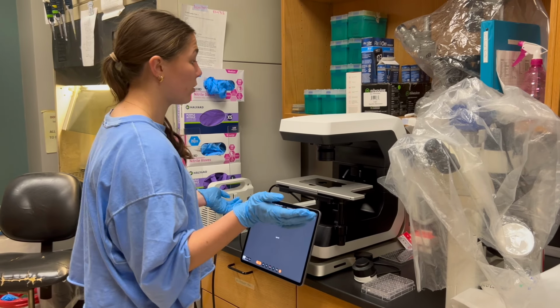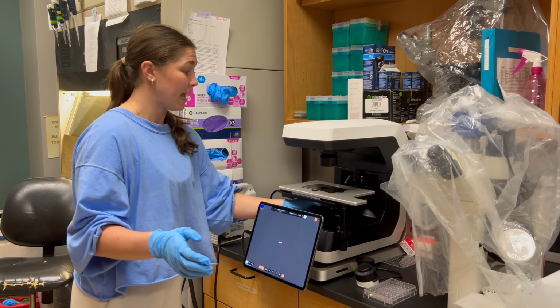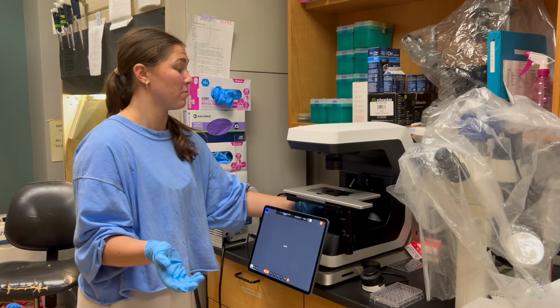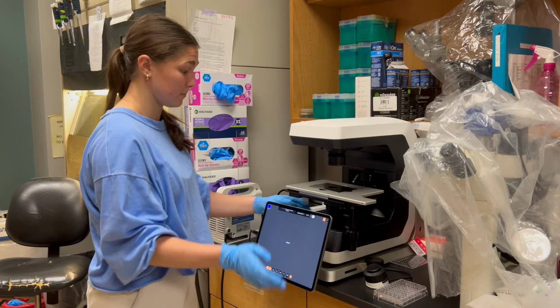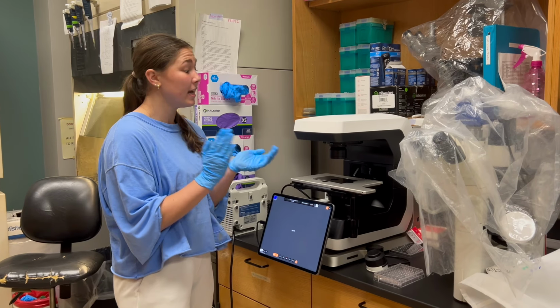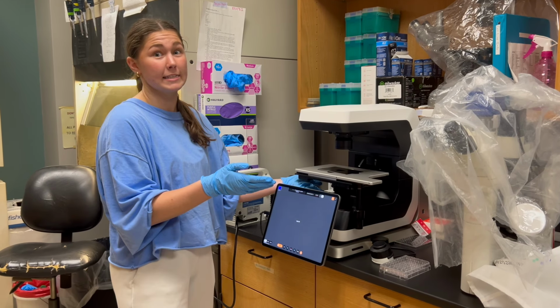And lastly, you're going to want to make sure that your lens is set to 4 times. If necessary, you can set it to 10 times, but we found that 4 times is the best for optimum viewing, and that is this red lens. Something really cool about this microscope is that it can actually be inverted. And so for our purposes, we recommend that the microscope is inverted with the lenses at the bottom.